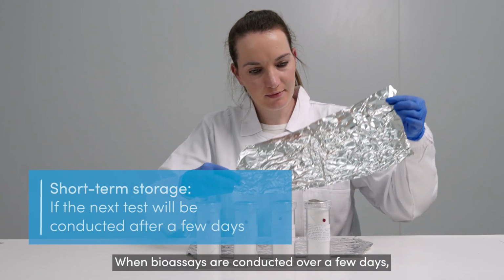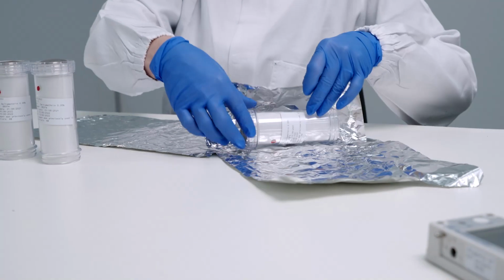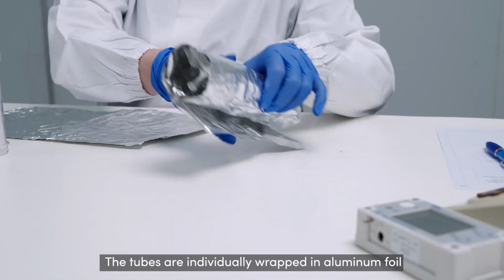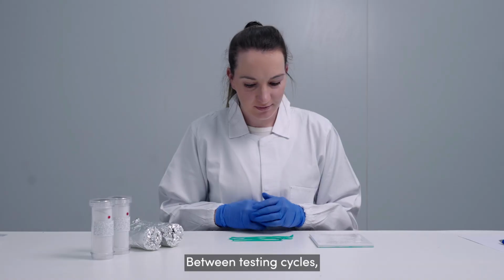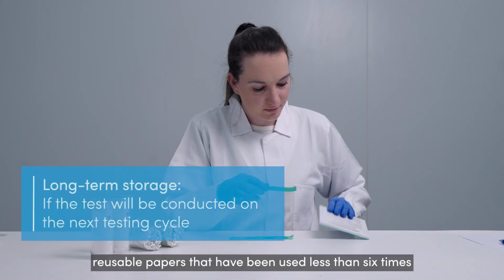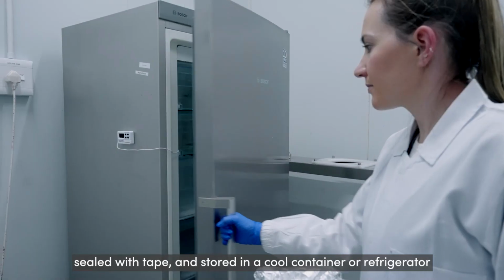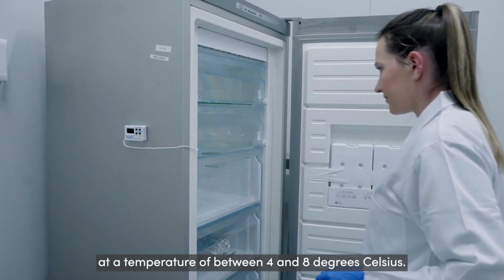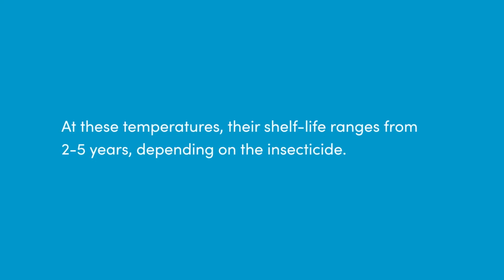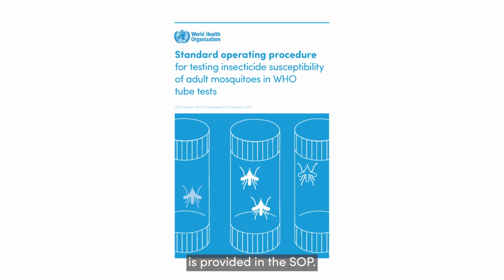When bioassays are conducted over a few days, impregnated papers can be retained in the exposure tubes provided. The tubes are individually wrapped in aluminium foil after each use and kept at a temperature of between 4 and 8 degrees Celsius. Between testing cycles, reusable papers that have been used less than 6 times should be kept in their original plastic box, sealed with tape and stored in a cool container or refrigerator at a temperature of between 4 and 8 degrees Celsius. At these temperatures, their shelf life ranges from 2 to 5 years, depending on the insecticide. More information on the shelf life of different papers is provided in the SOP.